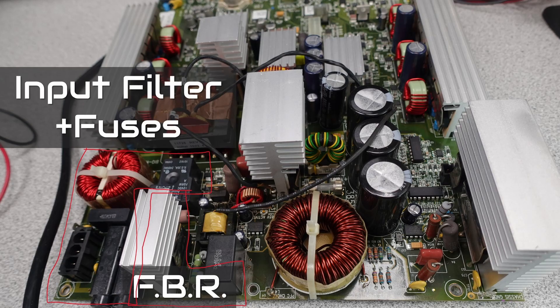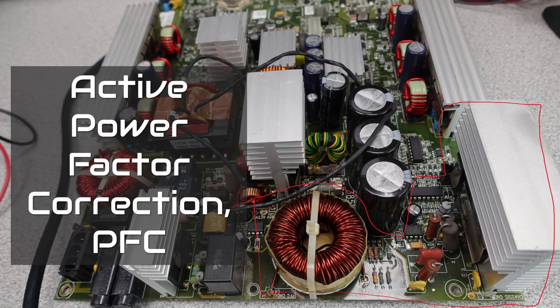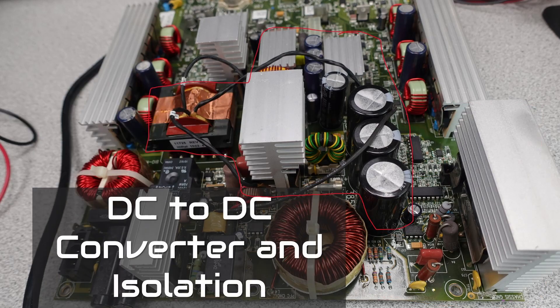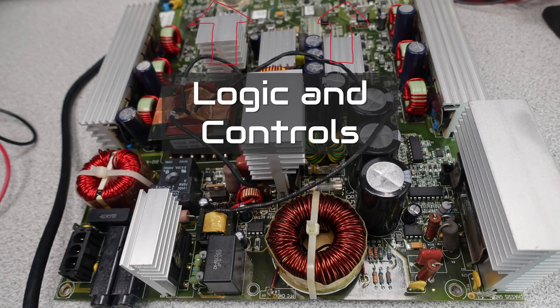This connects to the next part of the power supply which is the standby power supply. This supplies a low voltage to keep the components ready to turn on — and in this case it's always powered up even if the machine is off, and this section gets quite hot. After this, there is a large inductor and some switching components that make up the power factor correction circuit, which then leads into the main storage reservoir of energy — the large bank of high voltage capacitors. The isolation transformer is fed by a few more switching transistors making a DC to DC power converter stage to get the final voltages needed. Along the sides of the circuit board are two power supplies for each temperature controlled section of the reaction module. The CPU and glue logic fill the front section along with connections to the front panel, which has a compact flash card and a battery for storing the operating system and parameters like date and time.